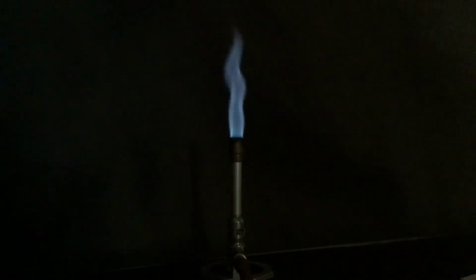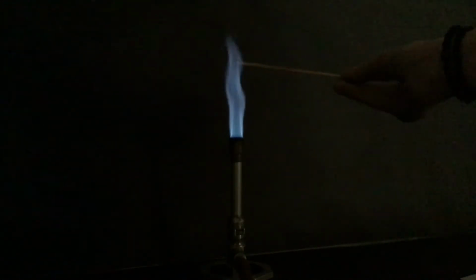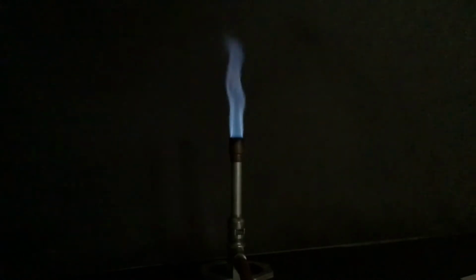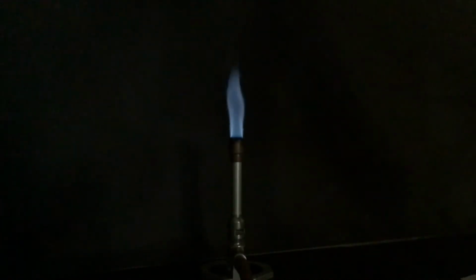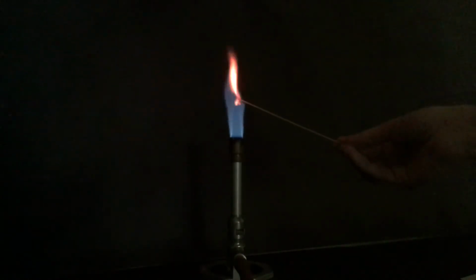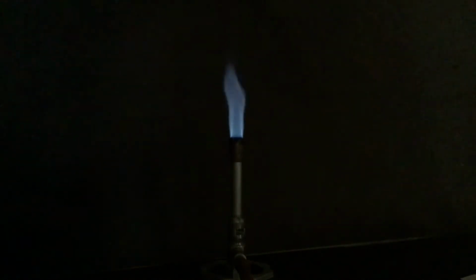So let me just start a new one here. One more time. So there's strontium.